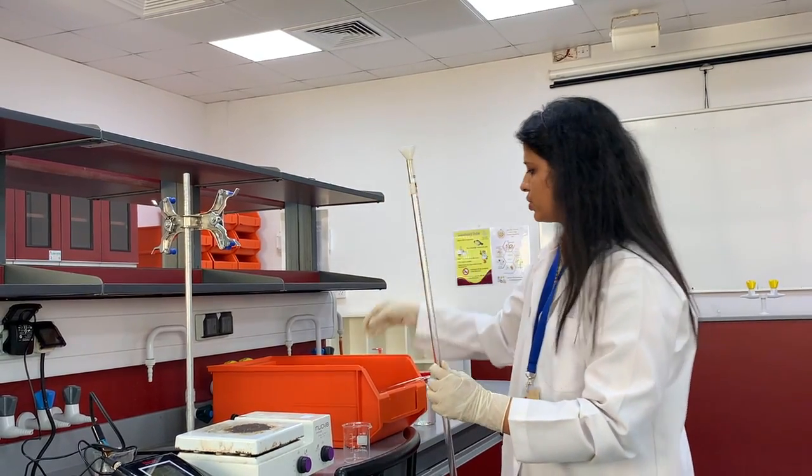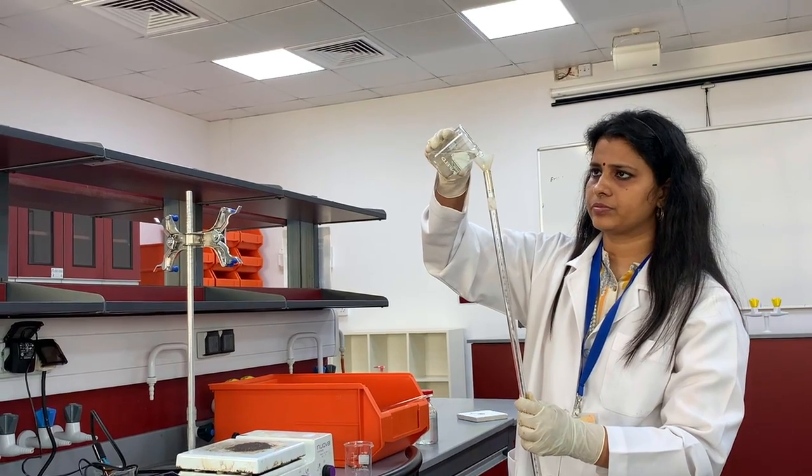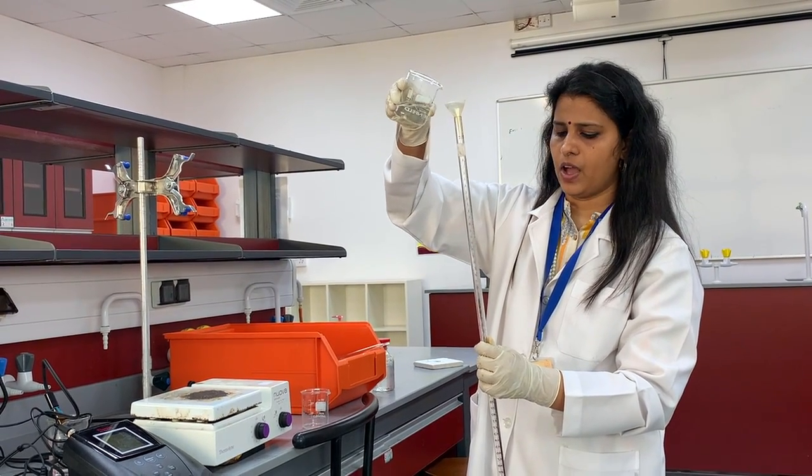Now, I'm going to fill with NaOH up to 0.